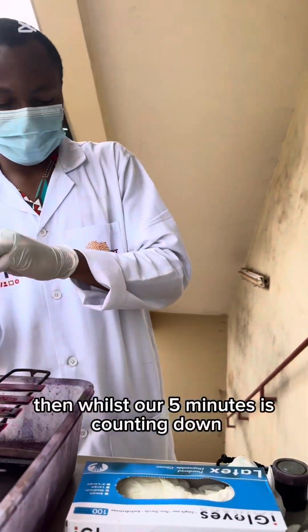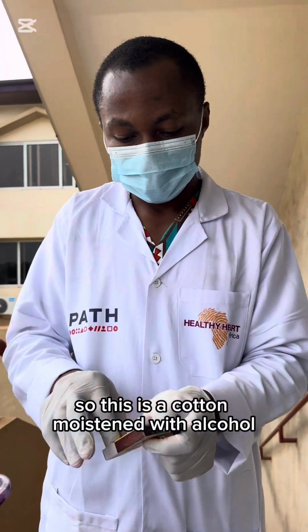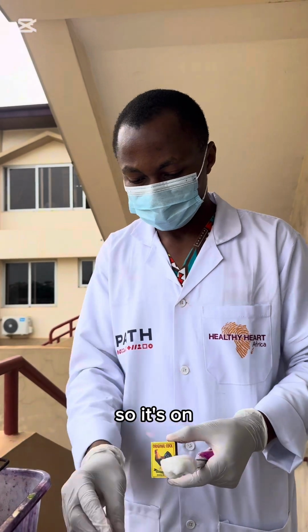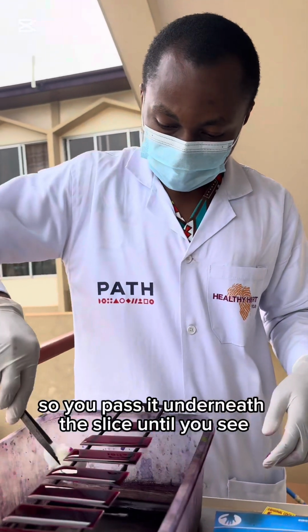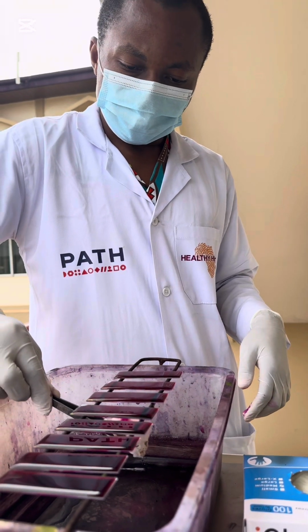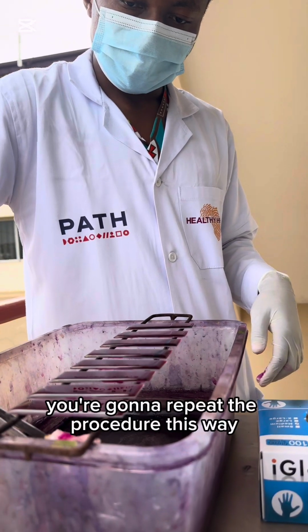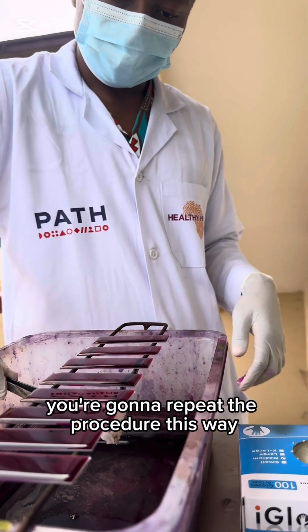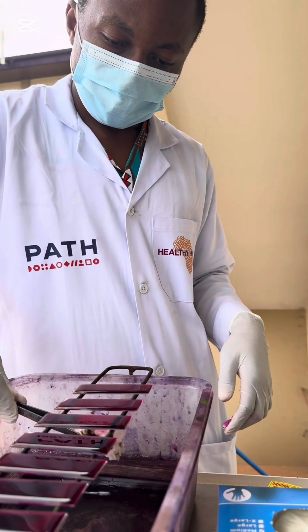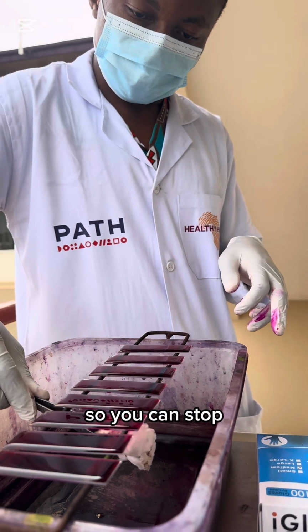And while our 5 minutes is counting down, we apply our fire or heat. So this is a cotton moistened with alcohol. So fire on like this, so it's on. You pass it underneath the slide until you see vapor coming out of the slide. You don't stop. We're going to repeat the procedure this way, until you see vapor. So don't overheat. This one is producing vapor, alright, so you can stop.